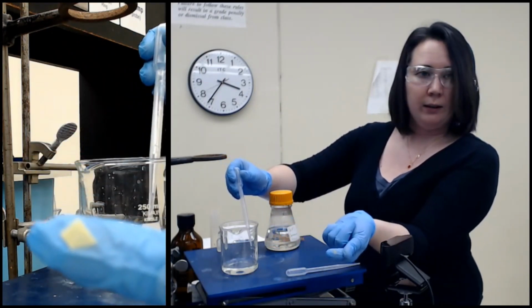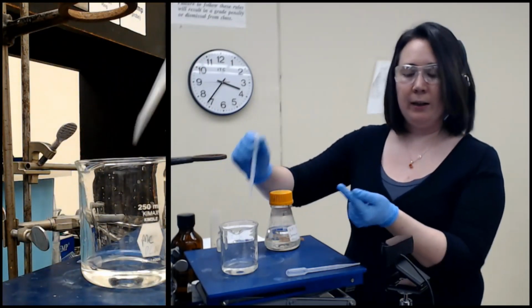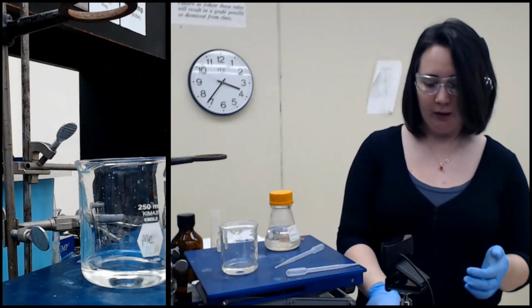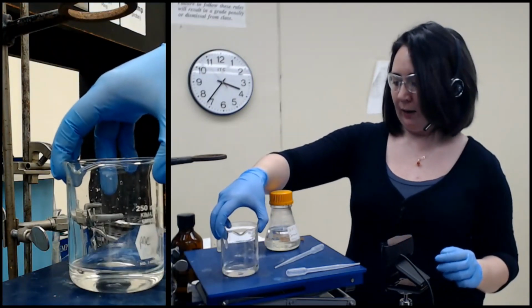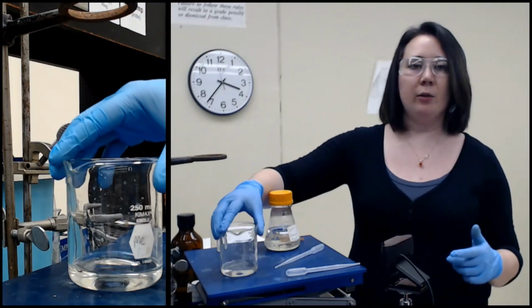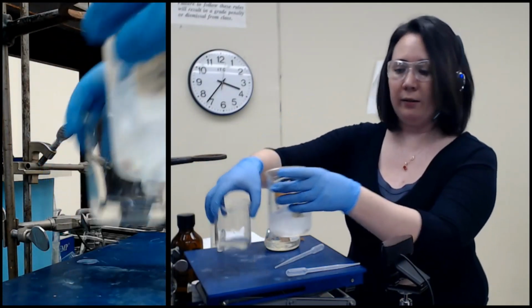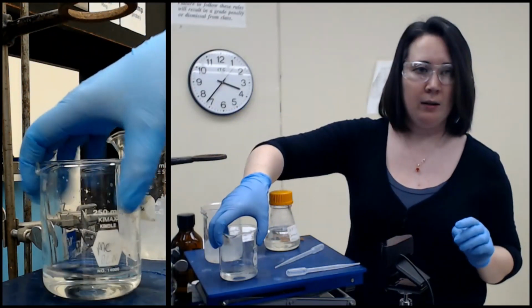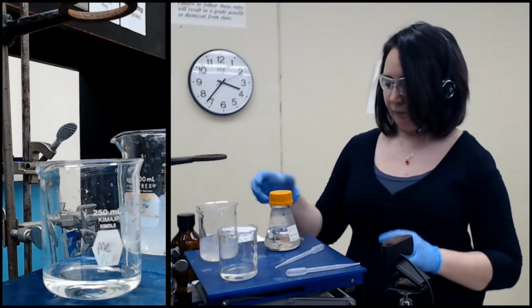I don't know how easy it is to see. It's a light green, kind of a limey sort of green, which I'm fairly certain is a pH of 8. I don't have the scale on me, but I'm pretty sure that's what it is. So what we need to do is start adding HCl carefully until we get to a pH of 2. I do know what that looks like. Because I know that it is going to get hot during the addition, I'm going to keep the ice right here in case I need it real quick.